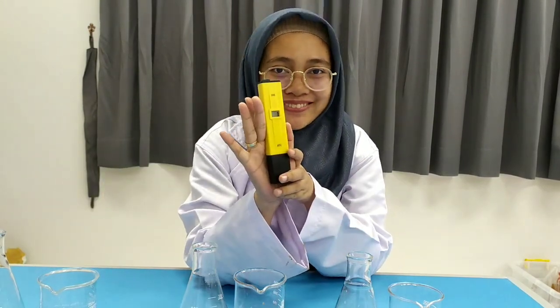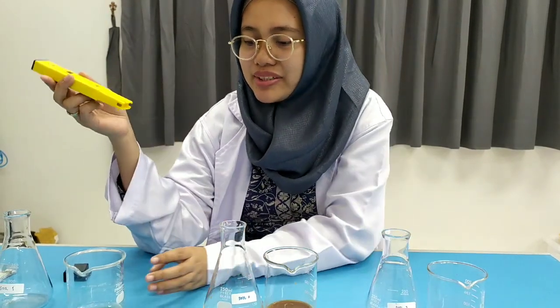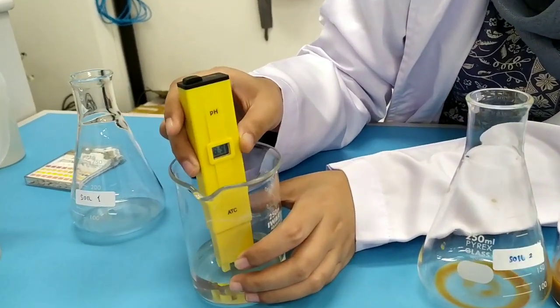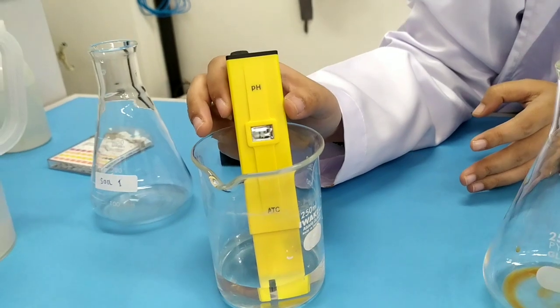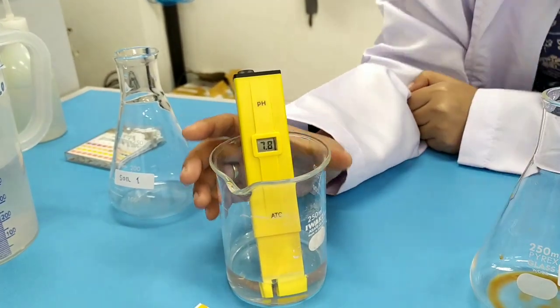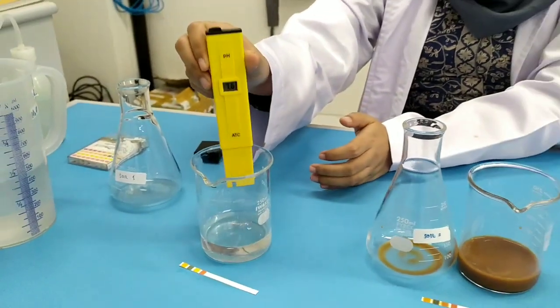We will check one more time using the pH meter. Let's turn it on. In the neutral position, it shows 7. We will dip it into the first soil. The pH will be shown on the screen. It's 7.9 — actually 7.8. I think it's 7.8. So from the pH meter, soil one is 7.8.